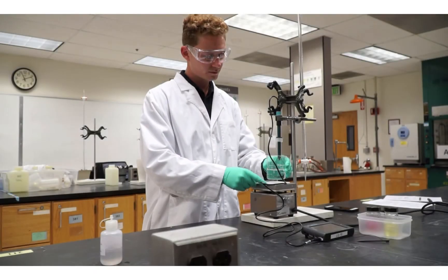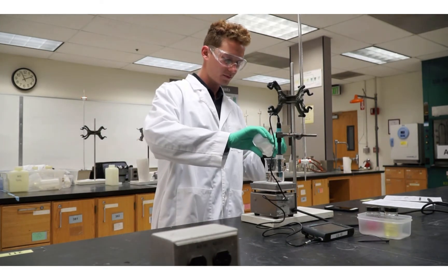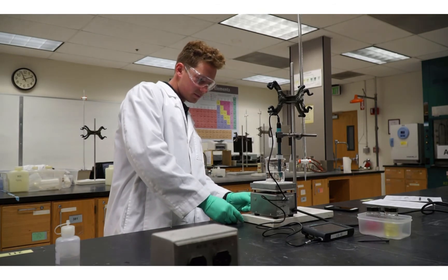Place your titration beaker on the stir plate with a piece of corrugated cardboard between the plate and the beaker. Lower your secured pH probe into the beaker. Make sure you have added the first indicator, phenolphthalein, and a magnetic stirring rod, then begin stirring.